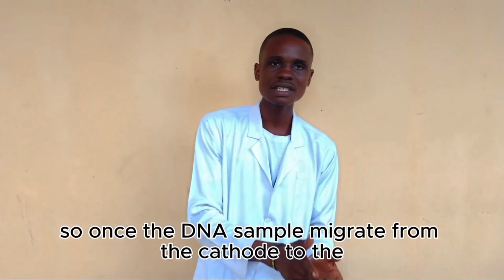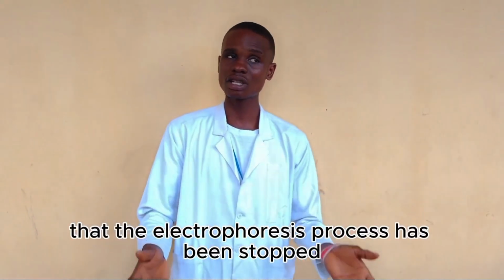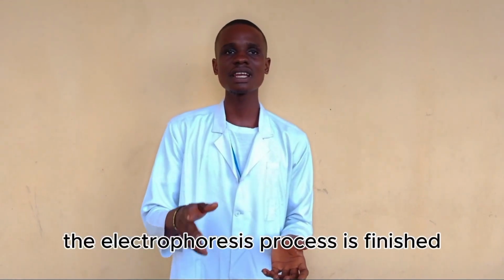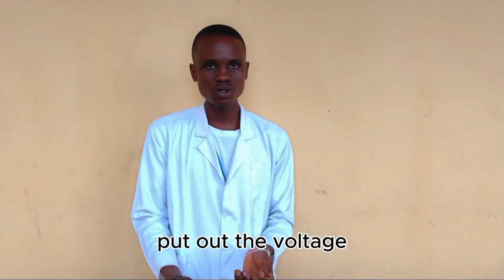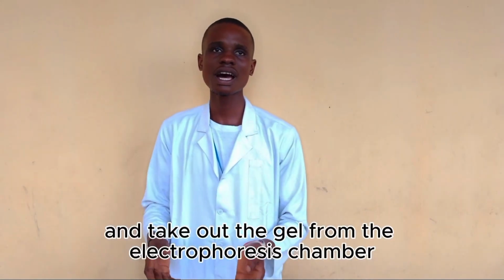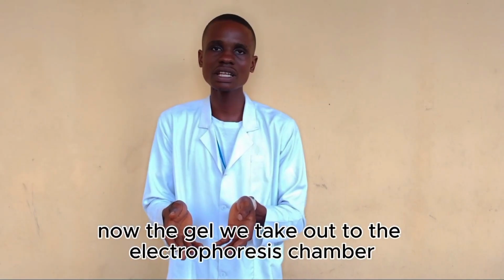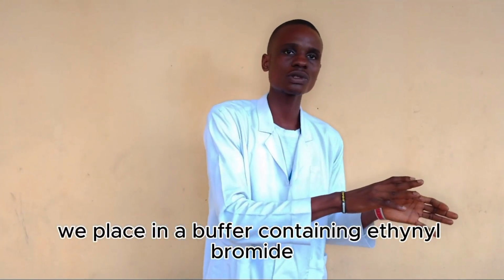So once the DNA sample migrates from the cathode to the anode, it is said that the electrophoretic process has been stopped. Then, immediately the electrophoresis process is finished, we put off the voltage and take out the gel from the electrophoresis chamber. The gel we take out of the electrophoresis chamber will be placed in a buffer containing ethidium bromide and TAE.